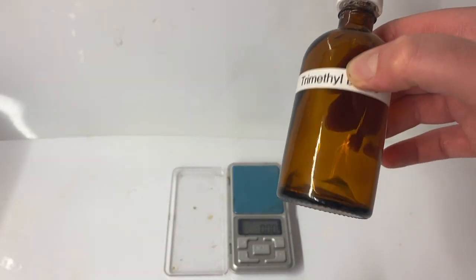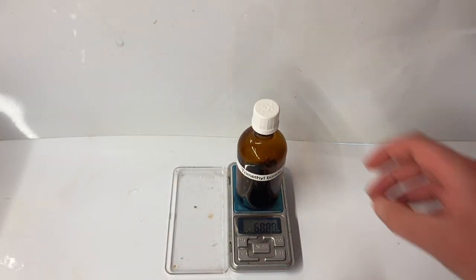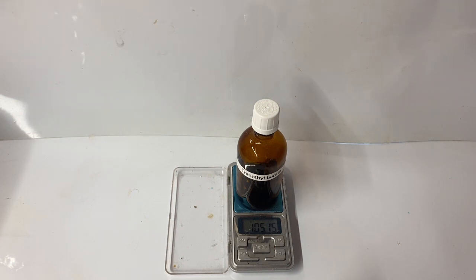One problem that I've got with this bottle is that I've burnt most of the trimethyl borate while filming the next part of the video and forgot to weigh it before. So I've only got 5 grams left.